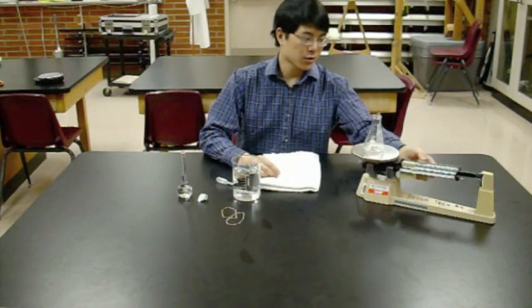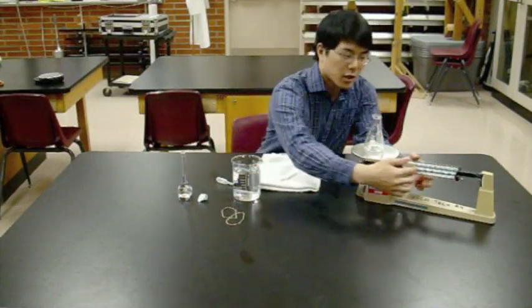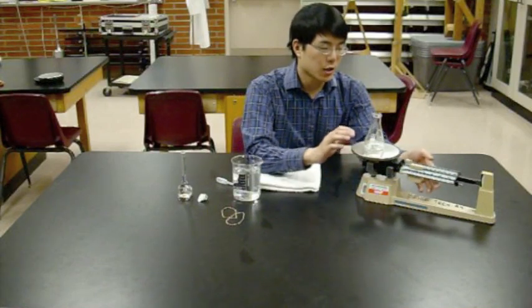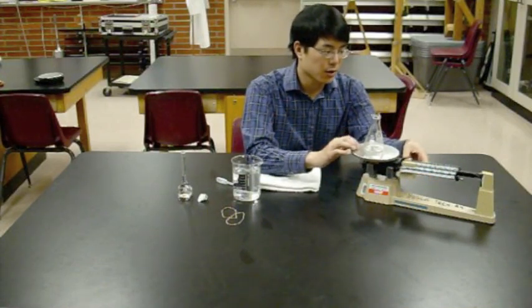And now we need a mass measurement for the empty Erlenmeyer flask. So put the Erlenmeyer flask on here. Reset all your sliders. Again, start with the heaviest slider. Tip the scale there.